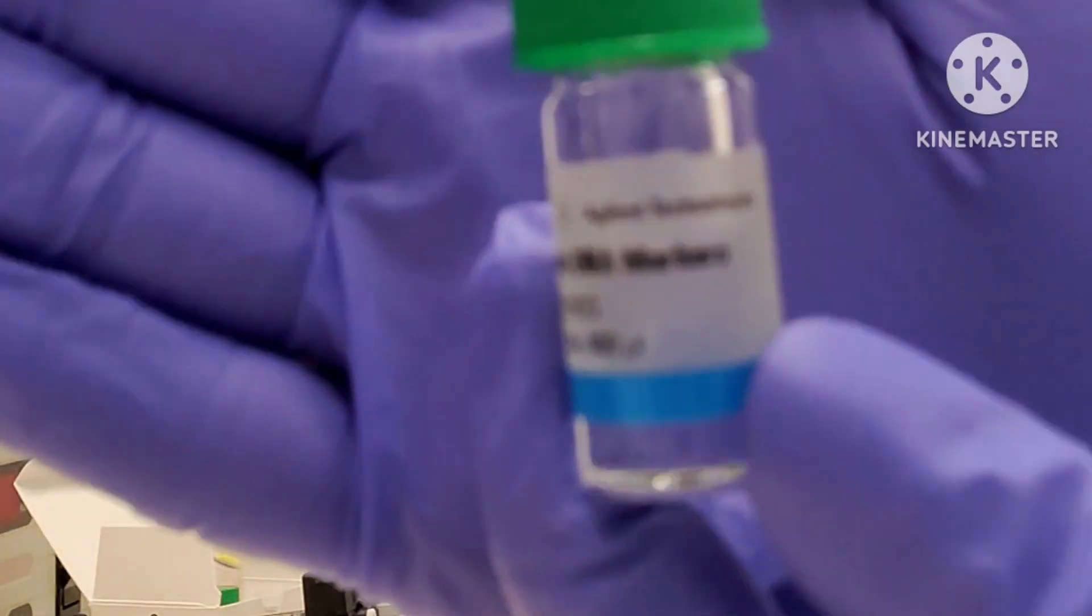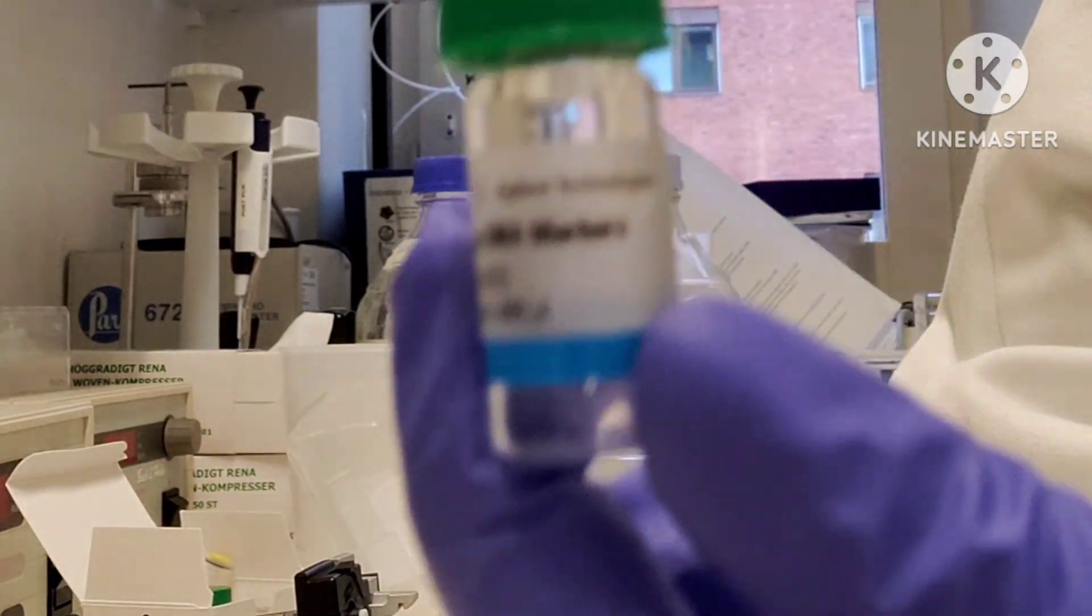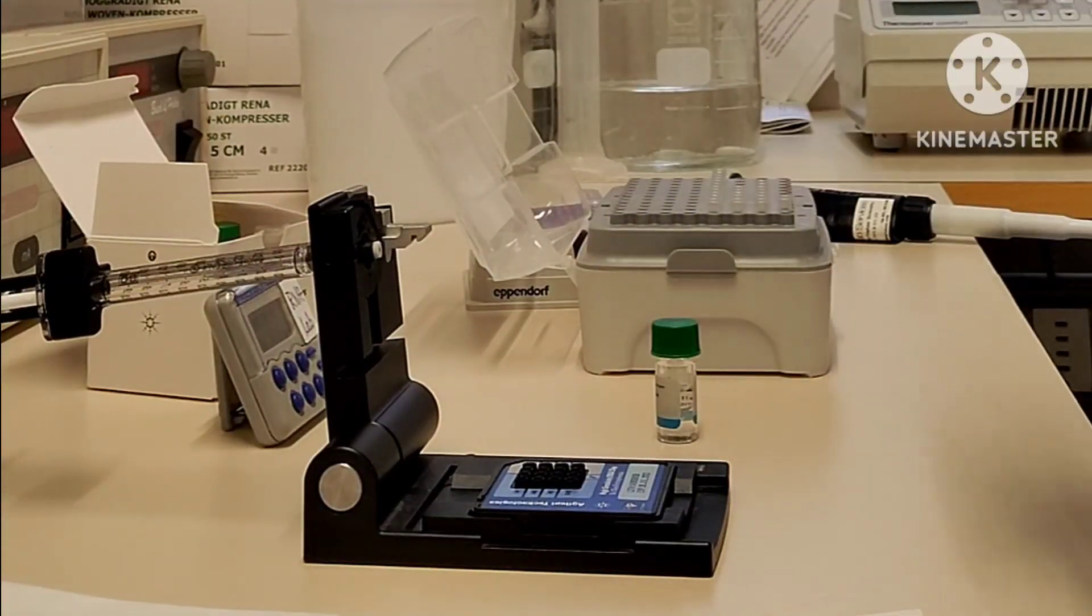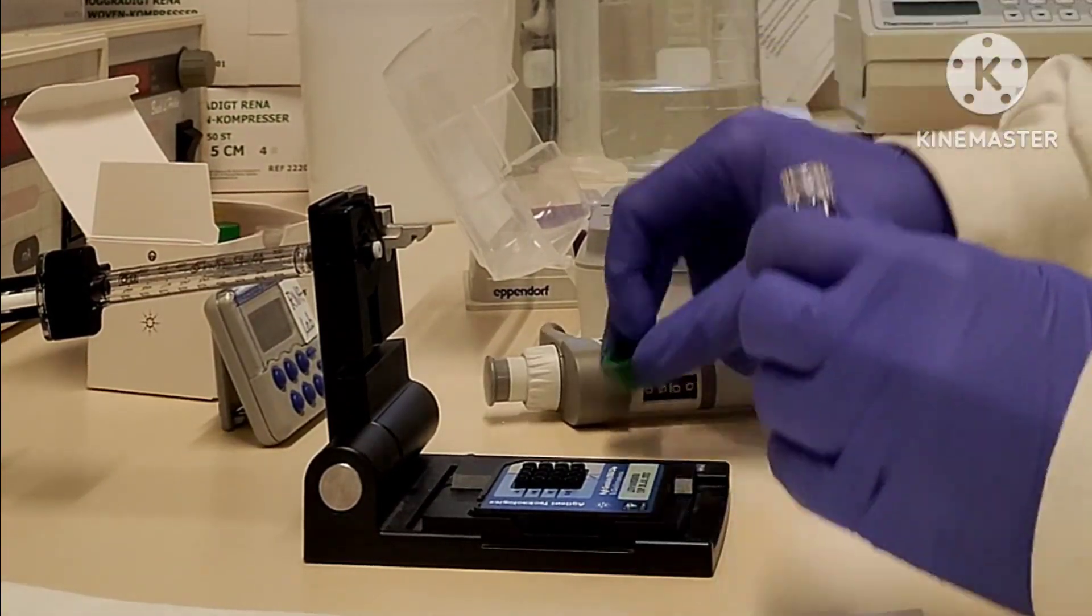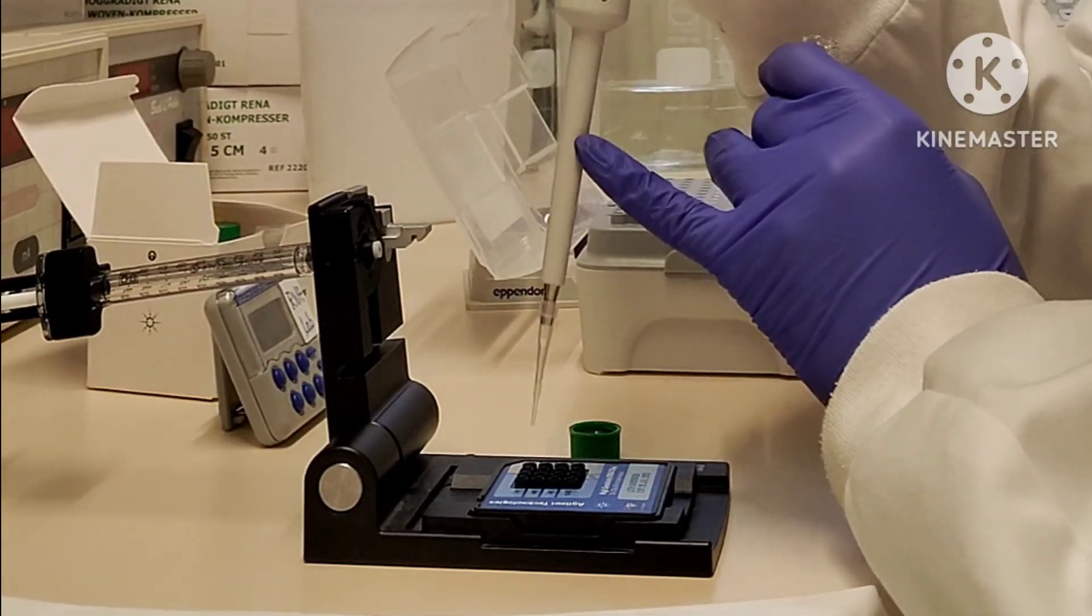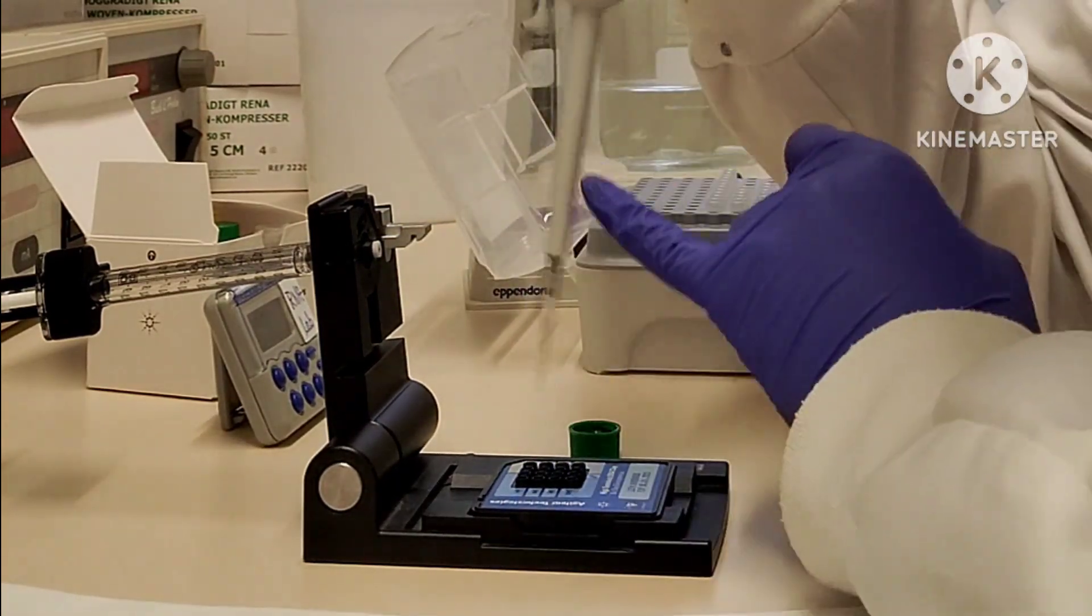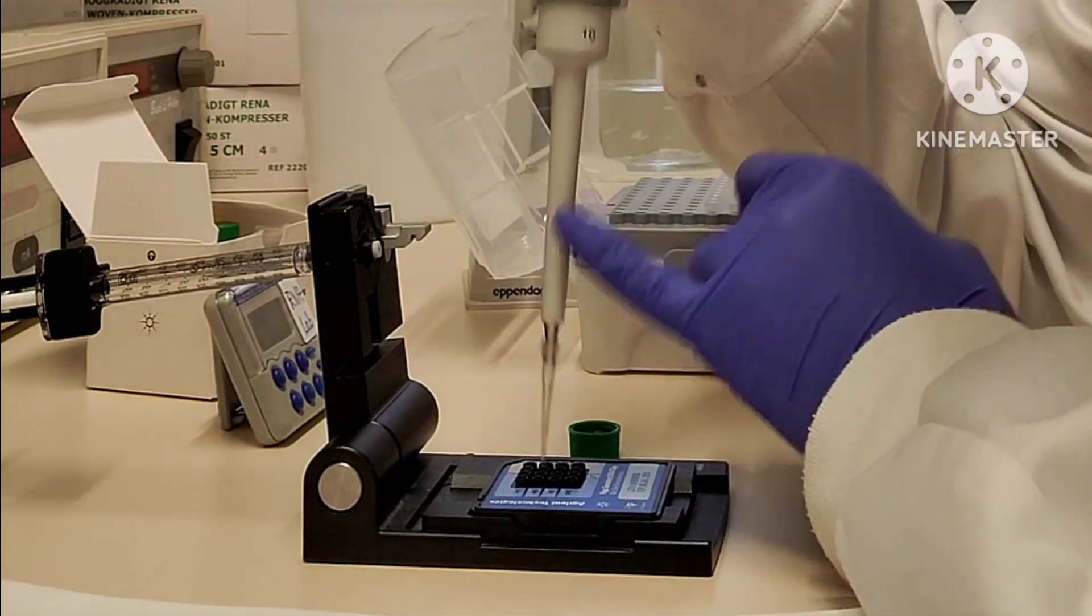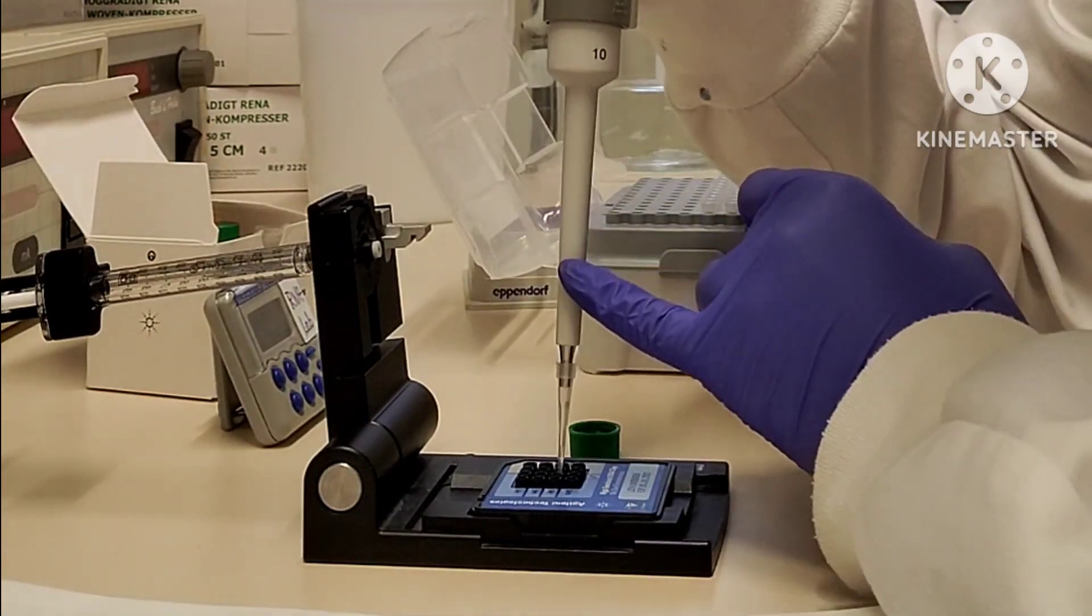This is the DNA marker. I'm not able to focus it clearly, but this is DNA marker. Just pipette 5 microliters of DNA marker into each well—in all the sample wells and in the ladder well. Since DNA marker is not that viscous, you can directly pipette it; no need to do reverse pipetting.